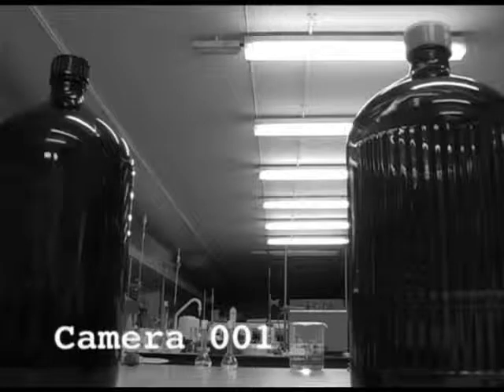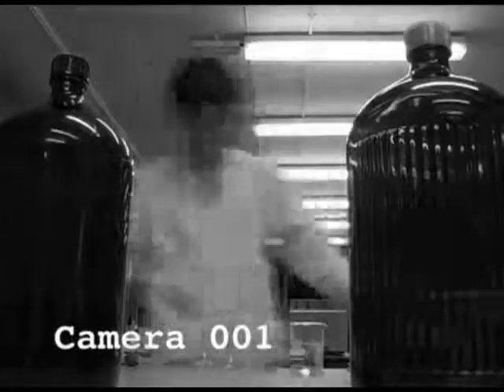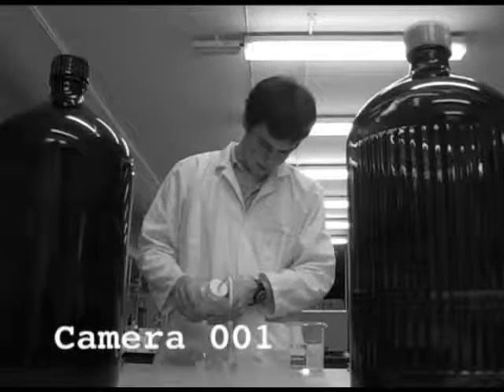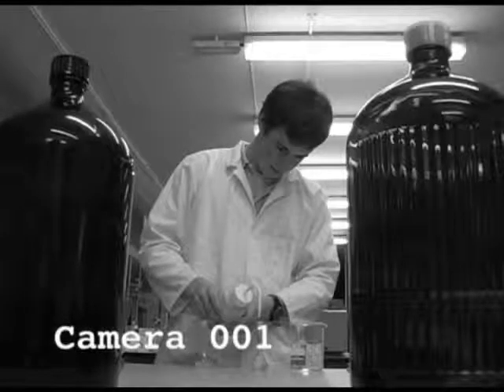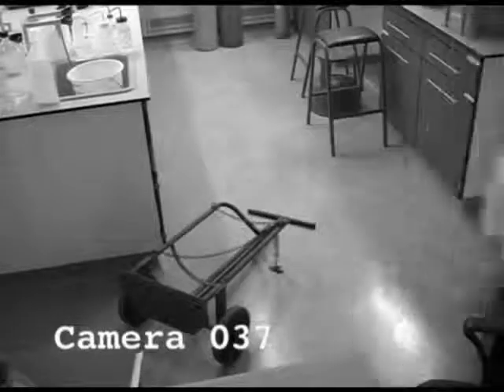Now I can see even from this distance that you are not wearing any safety glasses. I didn't realise I was being filmed. Not knowing that you are being filmed is not an excuse to not wear safety glasses. Now, if we just fast forward a bit here. I noticed you spilling a little bit there. Now, did you get any of that on your hands? A small bit, yes. And were you wearing gloves? No. Now, here we see a trip hazard, and you nearly fall over it.